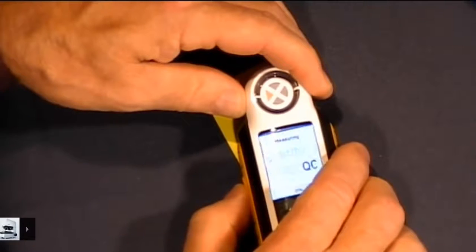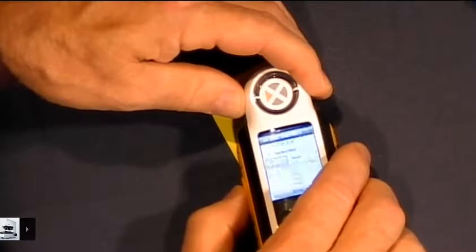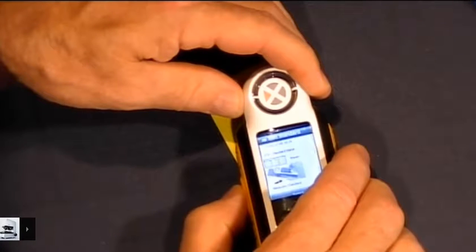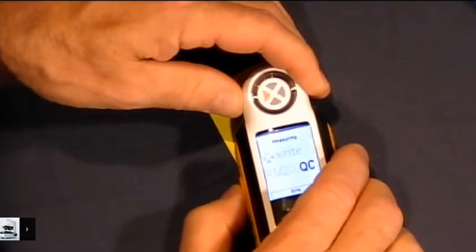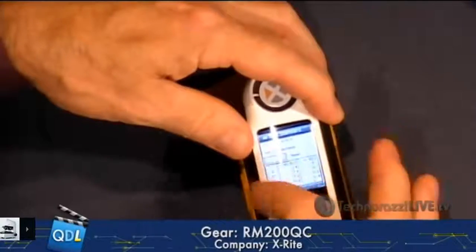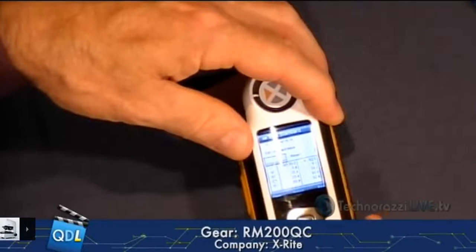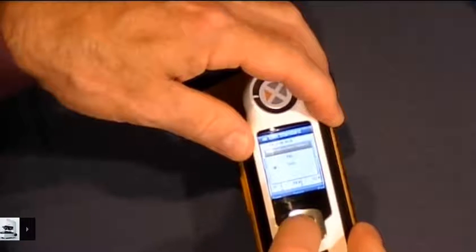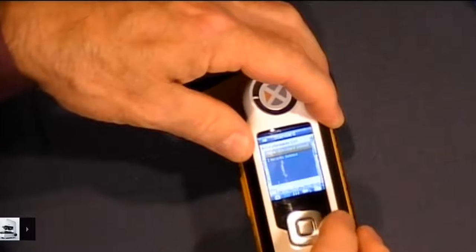So now we're going to take our measurements. There's our first measurement. Hey, no error message. There's our second measurement. And here is our third measurement. It will average those. And here's some details on those measurements, what the color attributes actually are. And now our standard is there. All I have to do is save it, tell it yes, and our standard is good to go.